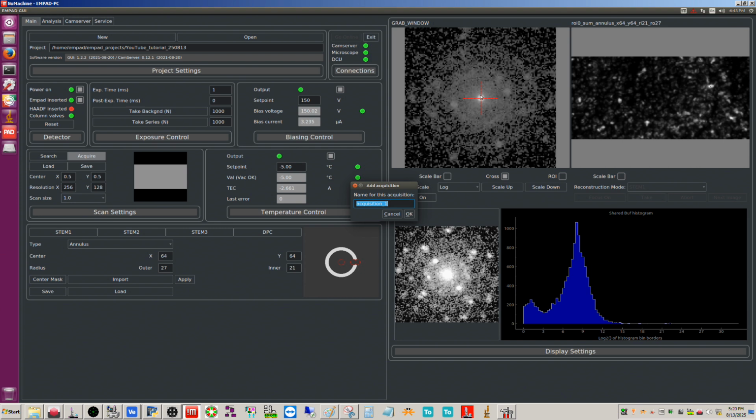So, all right, I'm going to call this gold palladium replica grating. And that's going to make a subfolder inside of this folder here with the data in it. And that's going to be a fairly large data set. I believe that's going to be about 2.2 gigabytes, if I'm not mistaken. A full data set at 512 by 512 resolution is about 17 gigabytes, just to give you an idea.